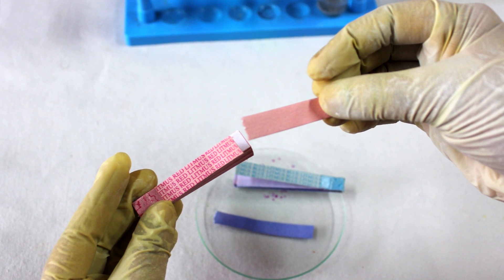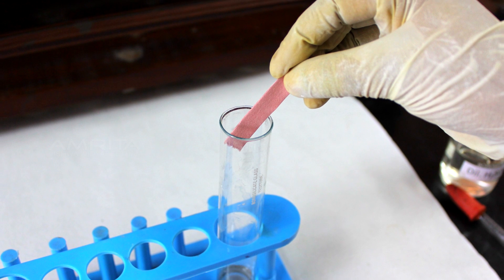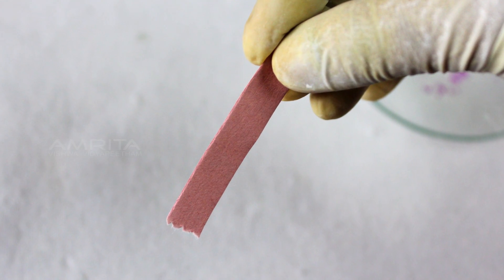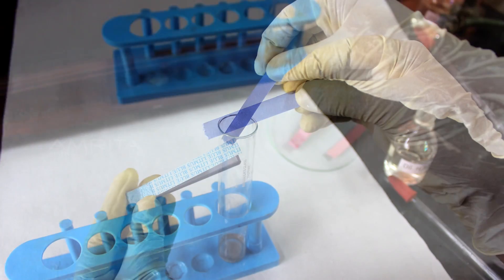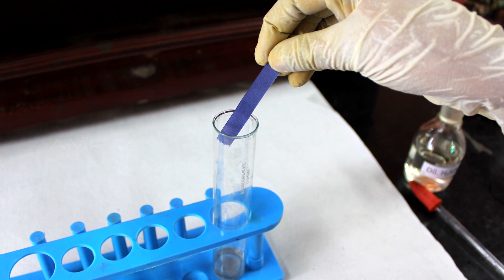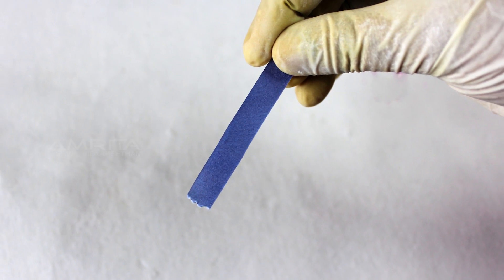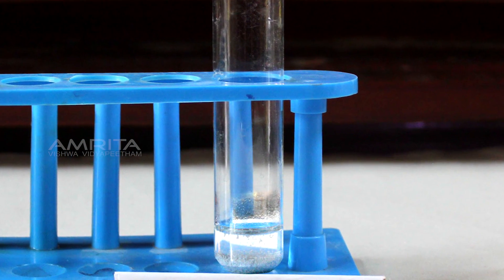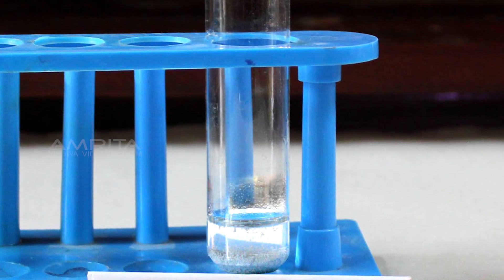Now, take a red litmus paper and hold it over the mouth of the boiling tube. There is no change in the colour of the red litmus paper. Repeat the same step with blue litmus paper. In this case as well, no change is observed. From this, we can infer that the hydrogen gas evolved is neither acidic nor basic in nature.